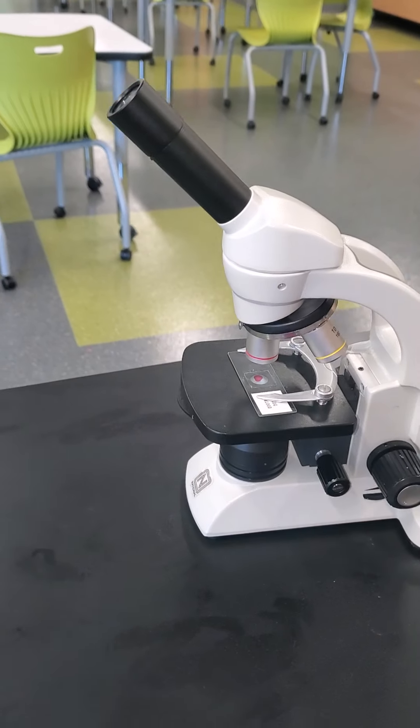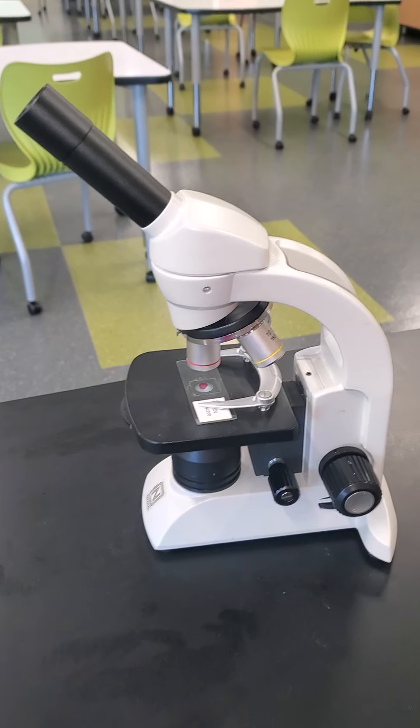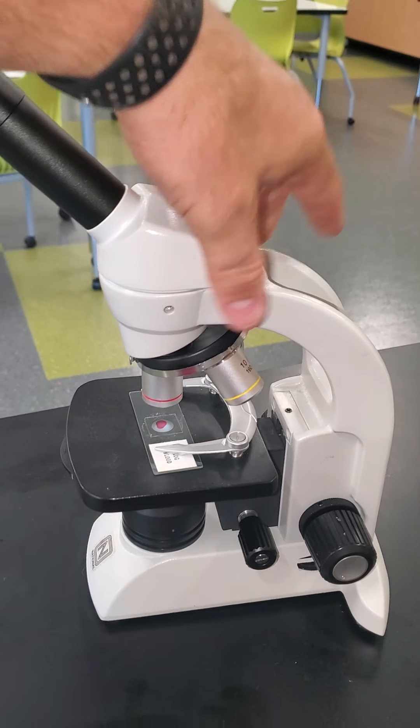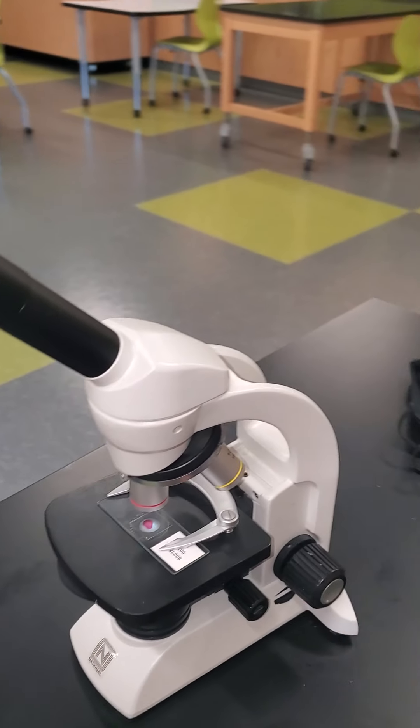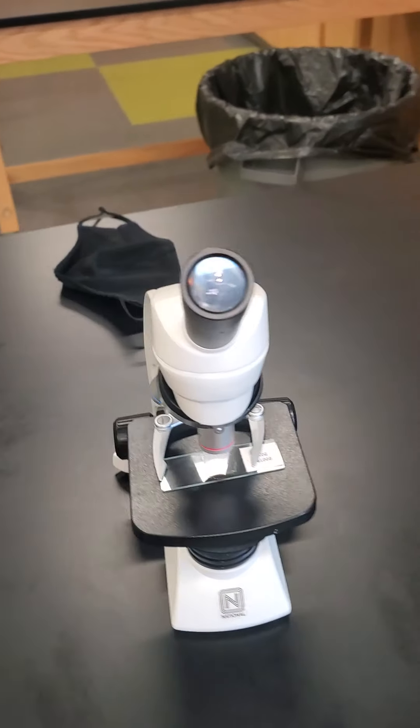And that is again the compound microscope that we'll be using here in class. Treat them with care, they are very pricey.